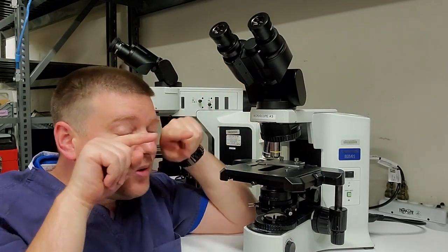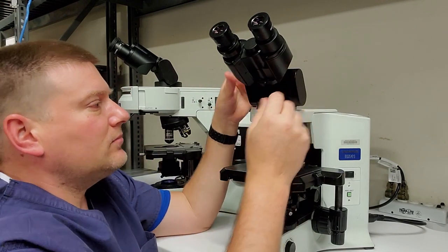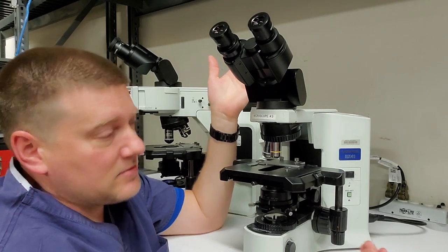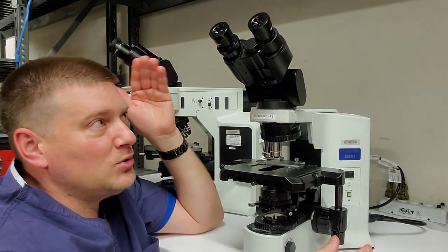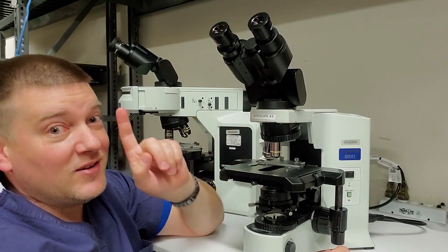Your interpupillary distance is going to be different for everybody. So that's that adjustment. And often they'll have one more pivot point right here where it attaches to the base. So that is your binoculars, and they're very expensive. Binoculars are usually thousands of dollars. So don't drop them. If you ever do take one off a microscope, don't drop them.